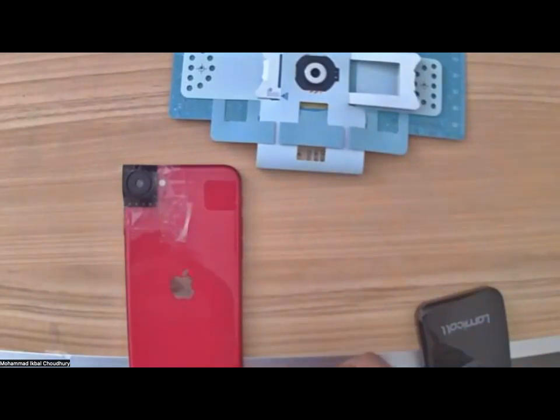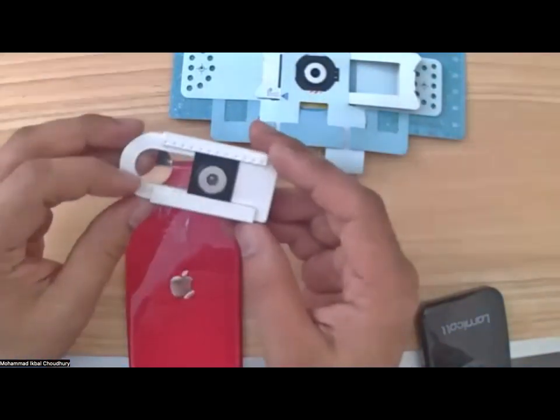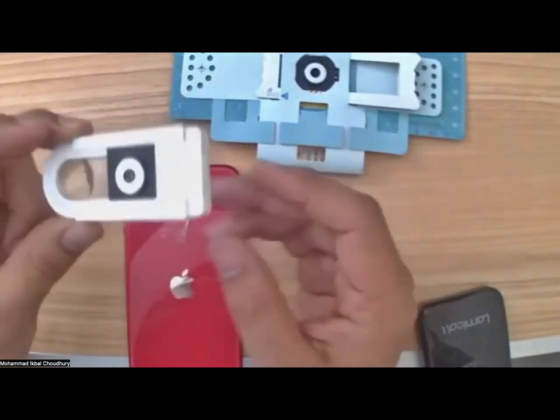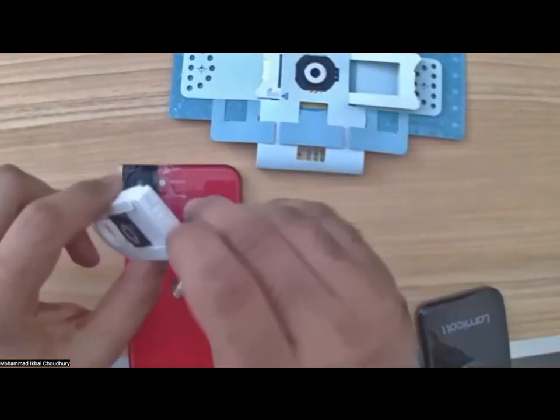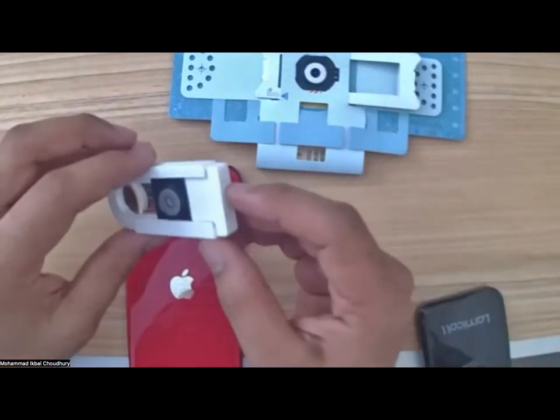Now, there's another piece of equipment that you must have received with your foldscope, which is this light source here. So if you take that out, yeah, perfect. There is a small strip of plastic that you can find here. Just pull it out, because that stops you from turning on the light source accidentally.